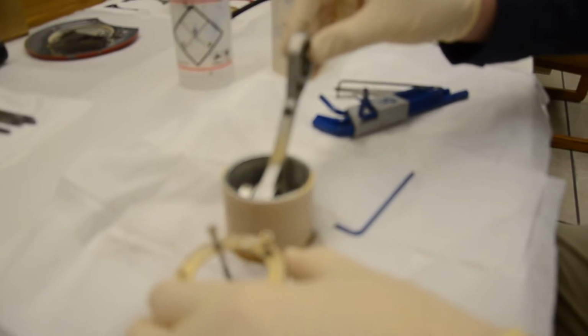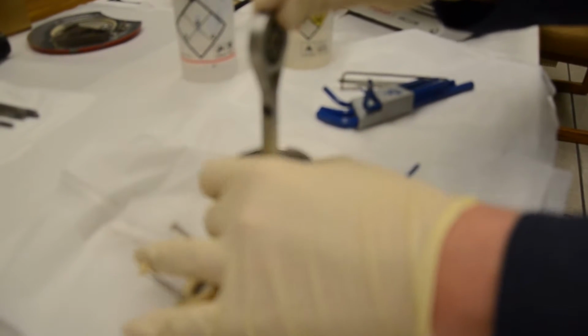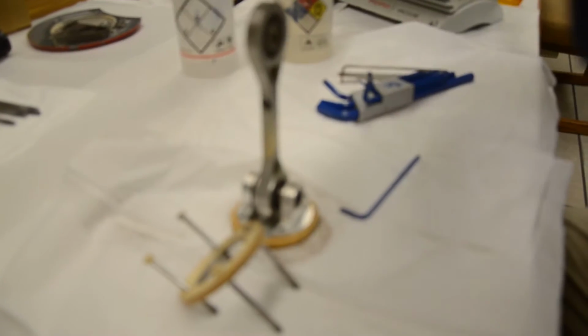So these can vary. They're not always the same. There are actually, I think, 4 different styles of these pumps, and each one of their piston assemblies can be different. They have some commonalities though. As you can see, it comes apart.